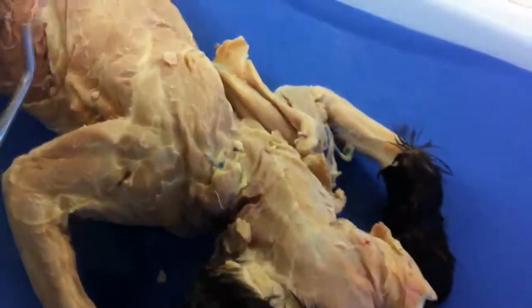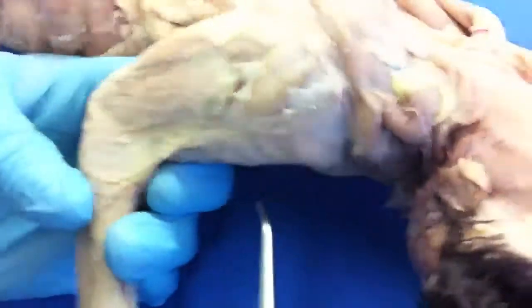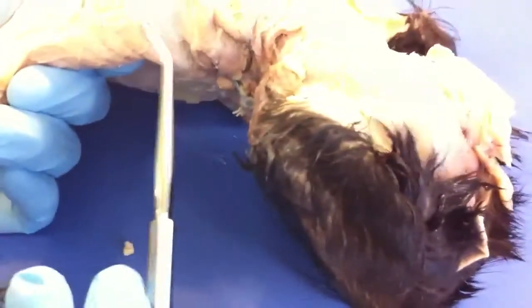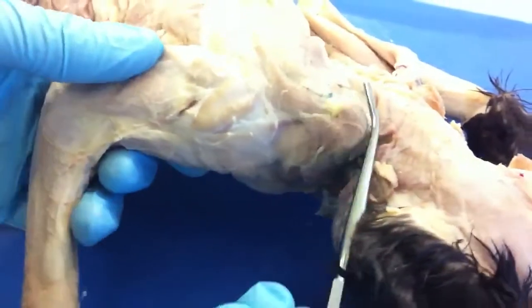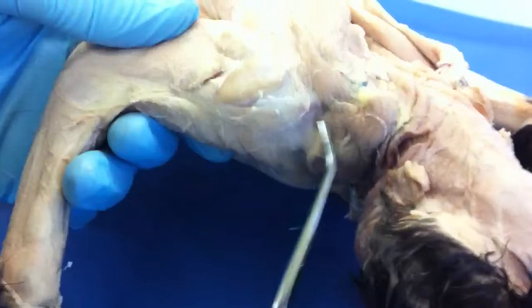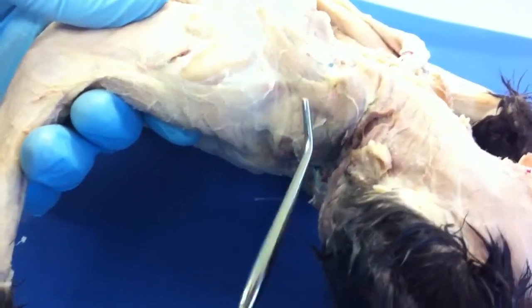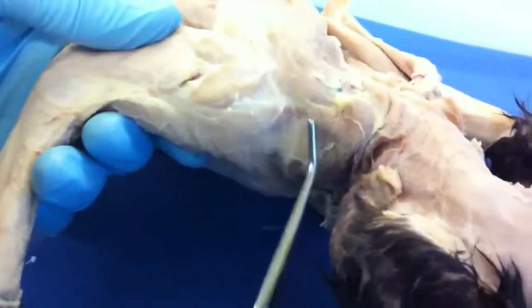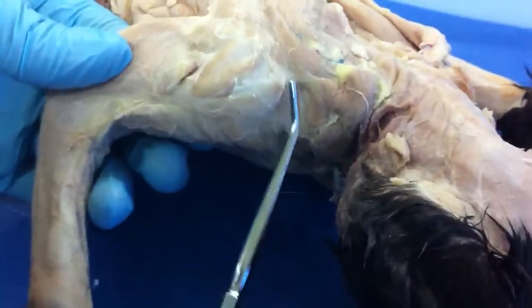Let's do the arm and shoulder part. First off, we have the clavotrapezius right here — the clavicle is barely noticeable if it's even there at all. Then we have the levator scapulae ventralis.